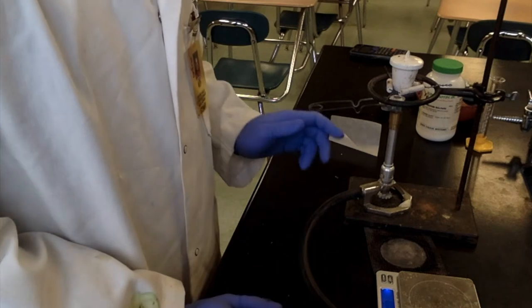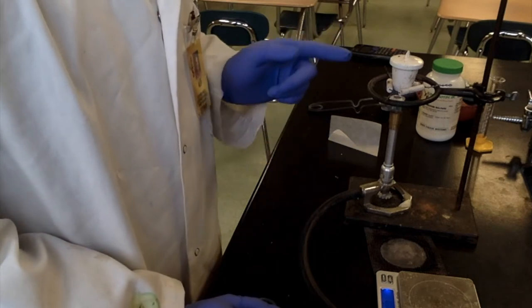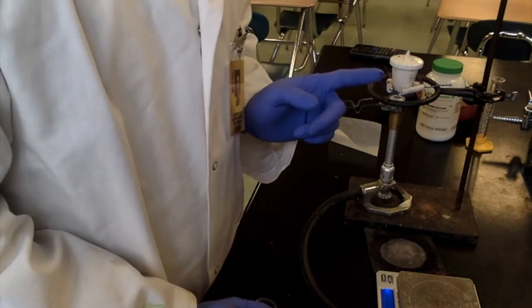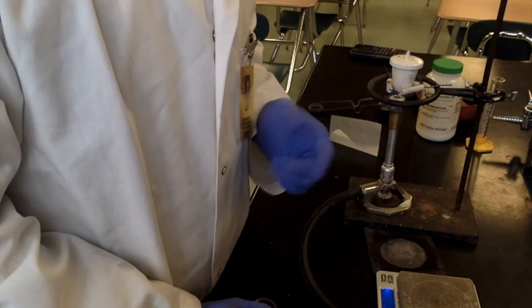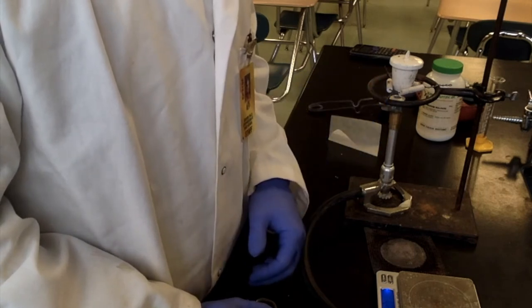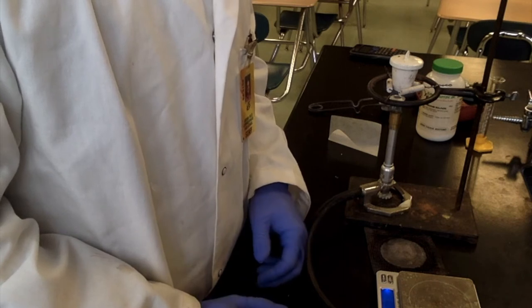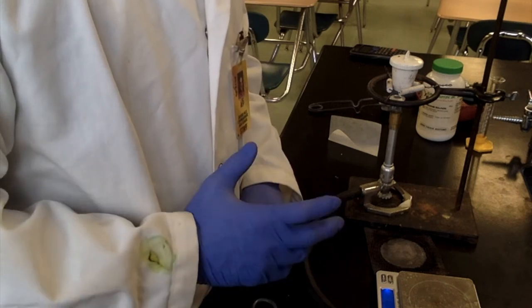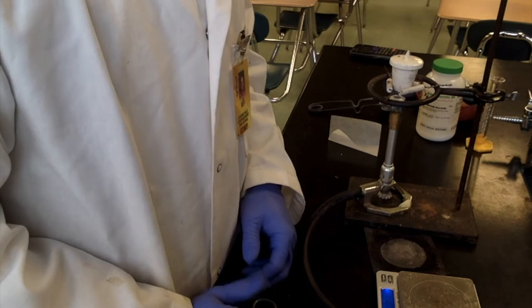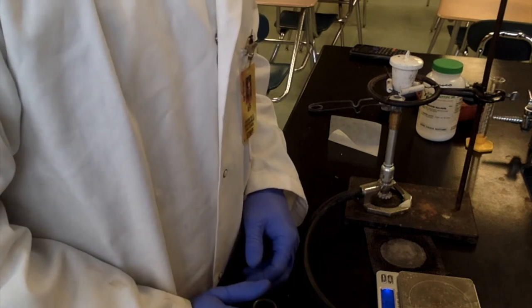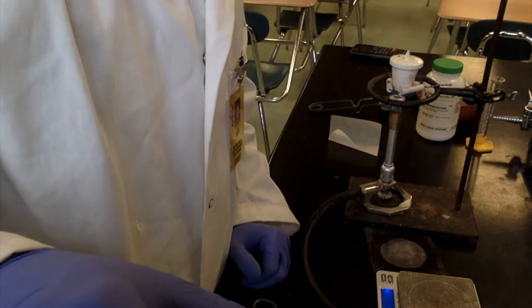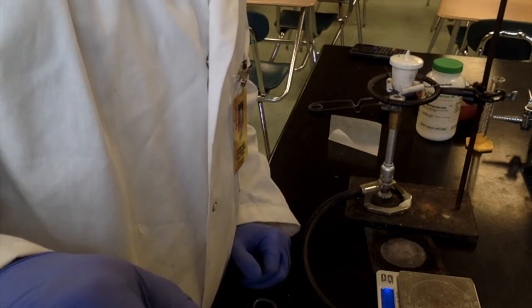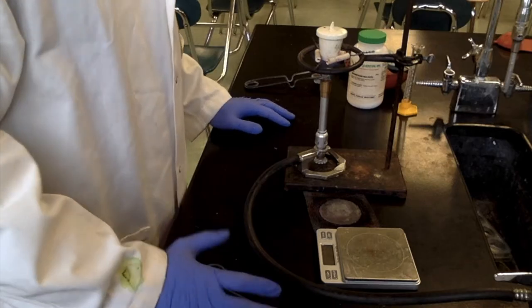All right. The container, I have the lid on securely. Oftentimes it's a good idea to have it cracked so that air can escape. But I don't want any material to kick out at me. So I'm going to leave it on so we don't lose anything. And I'll cut back after 10 minutes so you can take it off and get the mass.